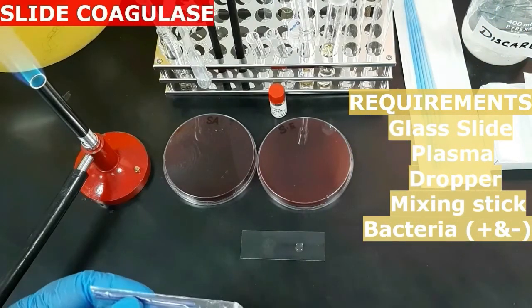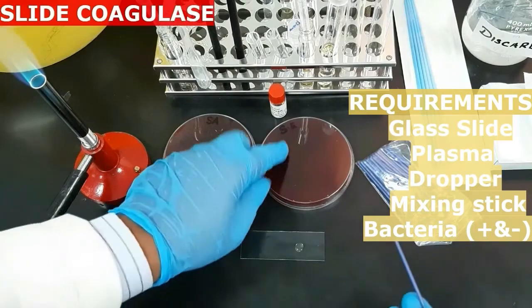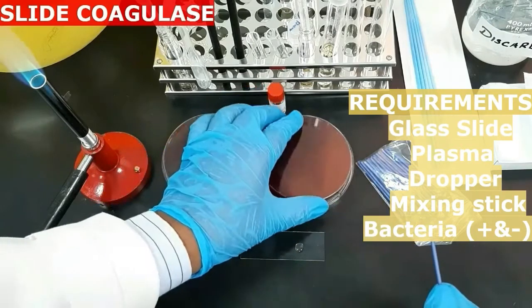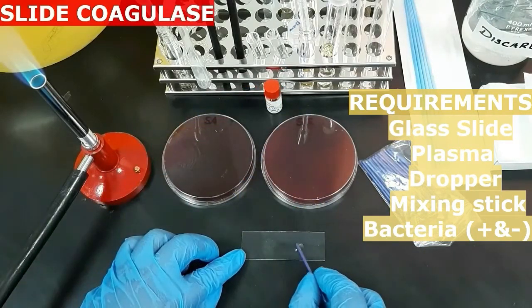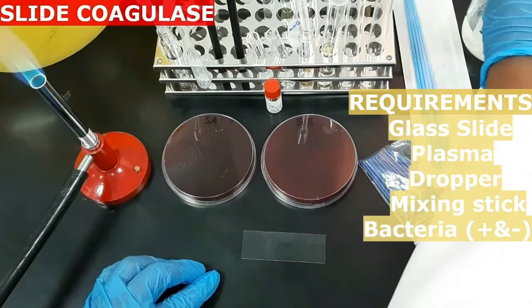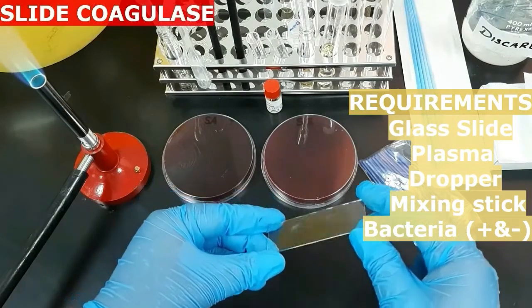Then with another mixing stick, transfer the negative control bacteria or the test to the second drop of the plasma and emulsify it. Then rock the slide back and forth and look for the formation of clots or clumps.